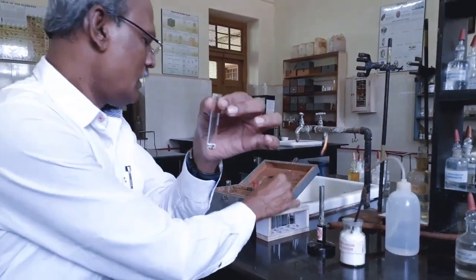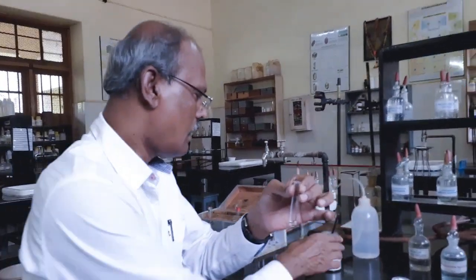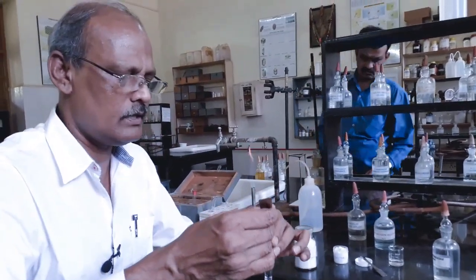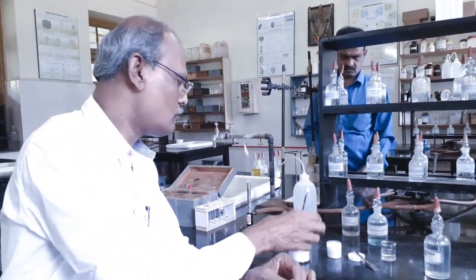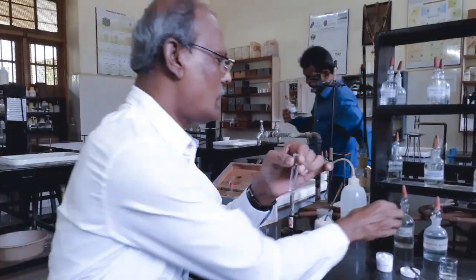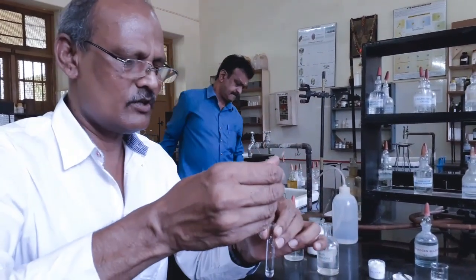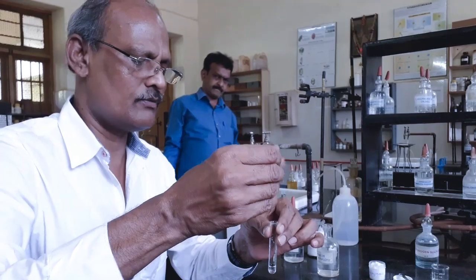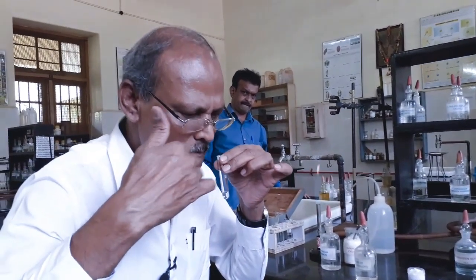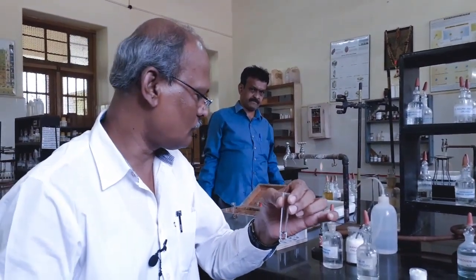and to this I am going to add the fifth group basic radical group reagent. They are solid ammonium chloride. I am adding solid ammonium chloride, about 1/3 spatula or half spatula, and after adding we must dissolve. Then we have to add 3-4 drops of ammonium hydroxide, dropwise in excess. After adding 2-3 drops of ammonium hydroxide, shake well, mix it well, wave the mouth of the test tube, gently inhale. You should get the pungent odor of ammonia. I am getting pungent odor of ammonia gas.